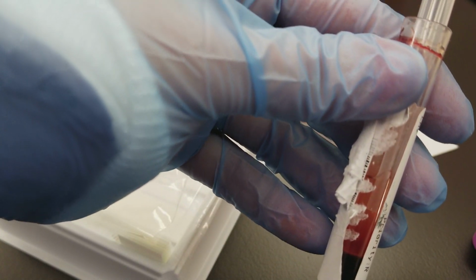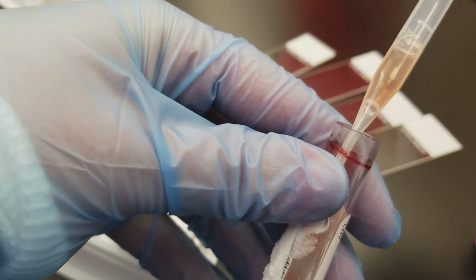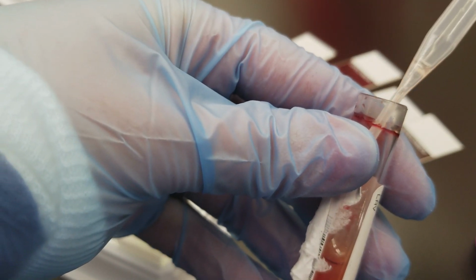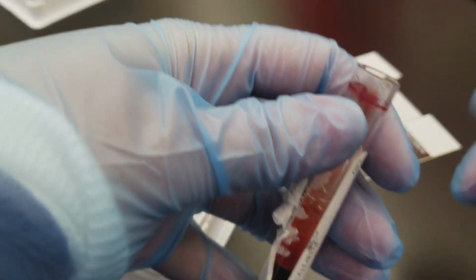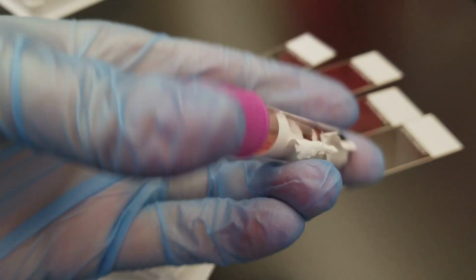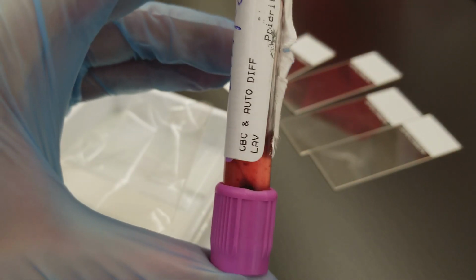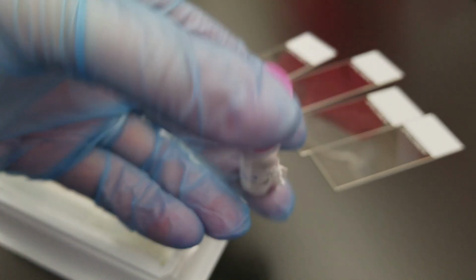Okay, so if I pull this up, the plasma is actually a beautiful color. It doesn't look lipemic, icteric, or hemolyzed. And the next thing I'm going to do now is cap it, and I'm going to slowly resuspend the cells into the plasma. Okay, so I'll get back to you after I'm done rocking this.